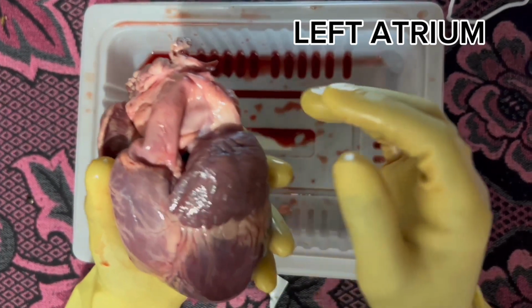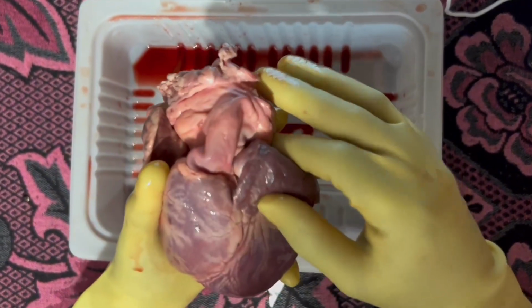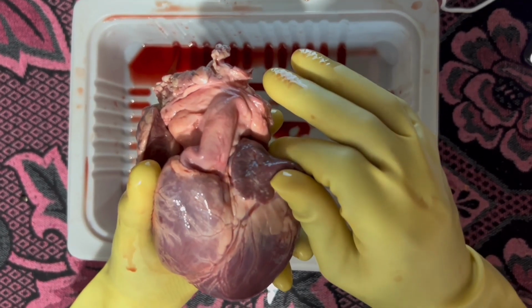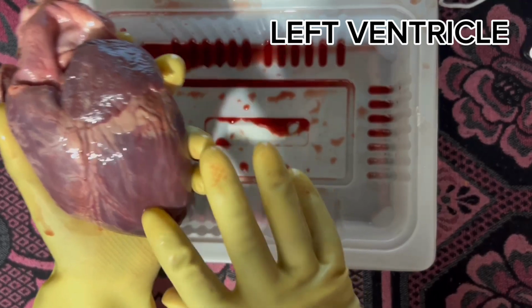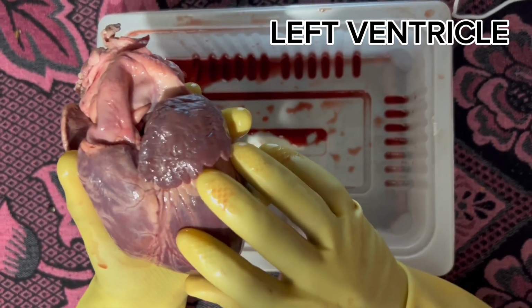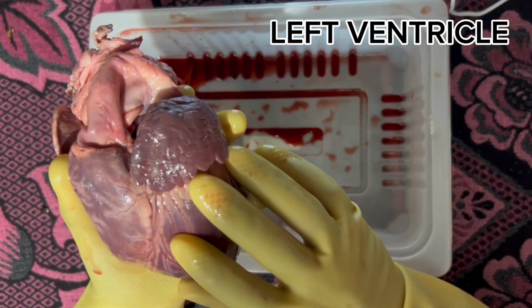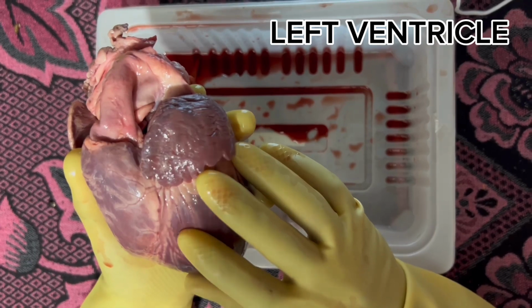From the left atrium, blood flows. This is the left atrium. The blood flows into the left ventricle. This is the left ventricle. The big part. The left ventricle pumps the blood to the aorta, which will distribute the oxygenated blood to all the parts of the body.